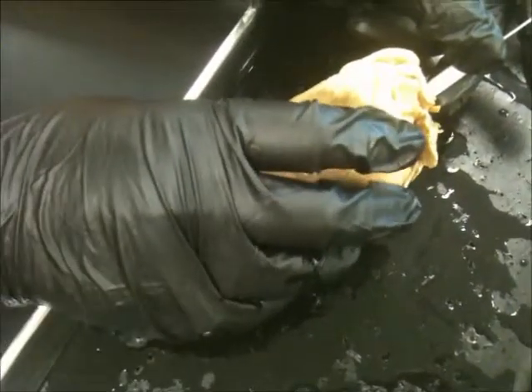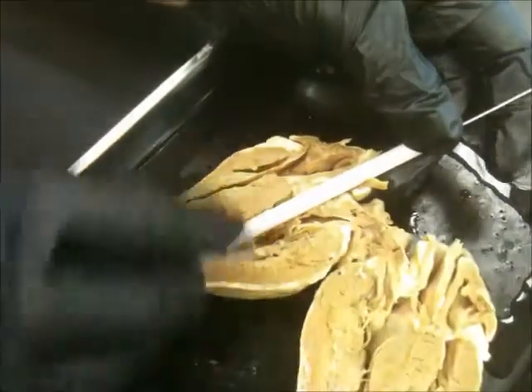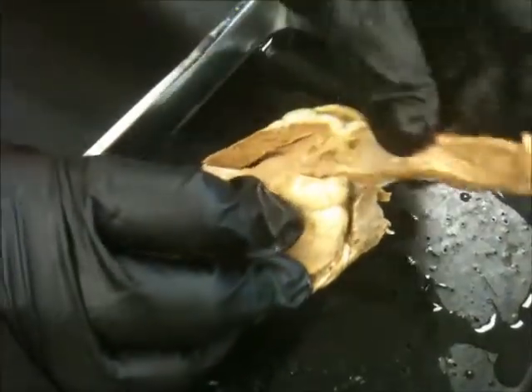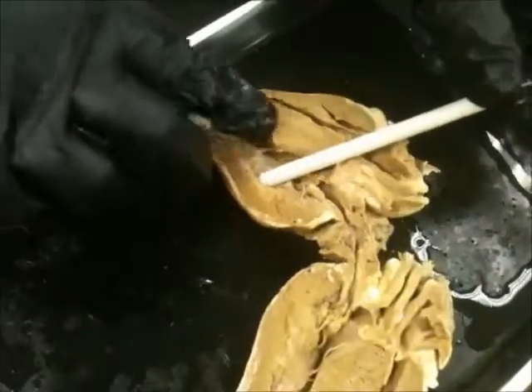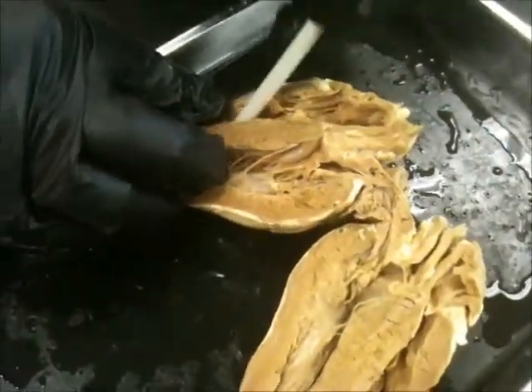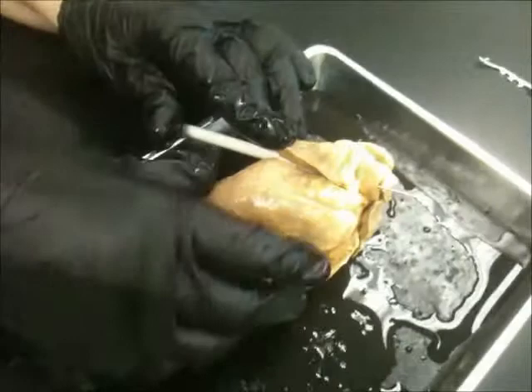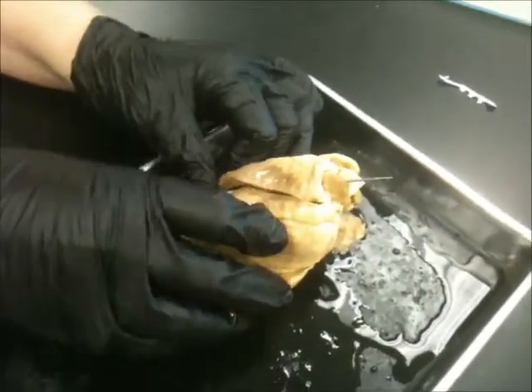What are we looking for again? We're looking for the pulmonary artery. So the pulmonary artery comes up from the right ventricle. It comes up and goes out to the lungs, right? It's coming from here and going out here to the lungs. The way this is cut, you really can't see the pulmonary artery. It is anterior to the aorta, and it's going to go from the right ventricle out to the lungs.